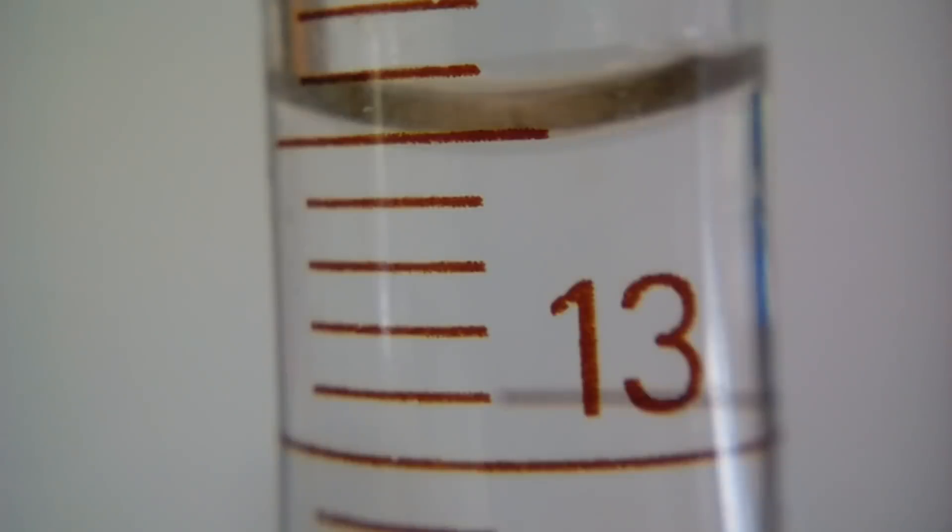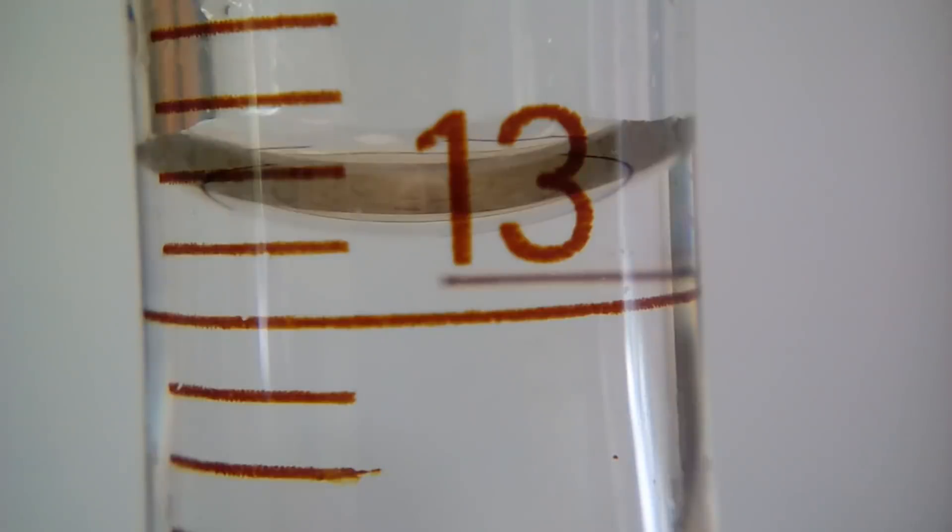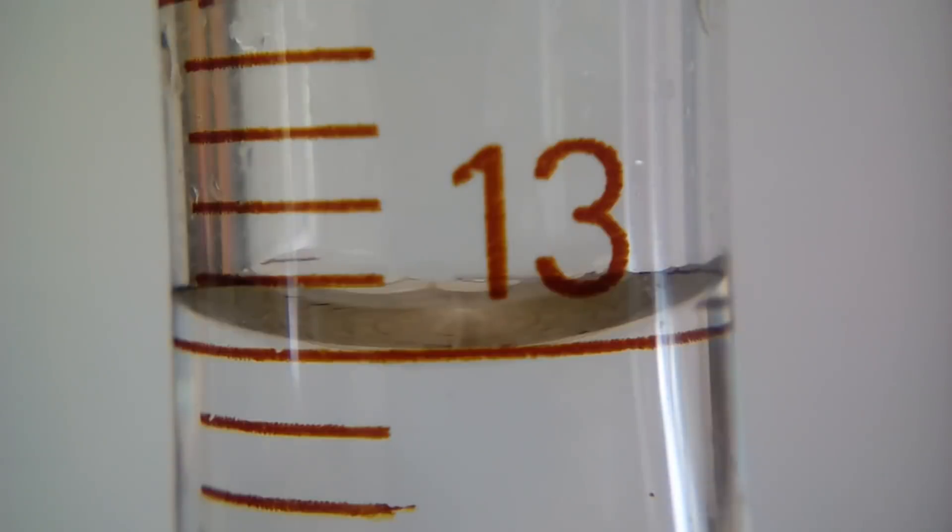I repeated the experiment three times and here we can clearly see the three different results of the experiment. Take these down to help with the calculations later.